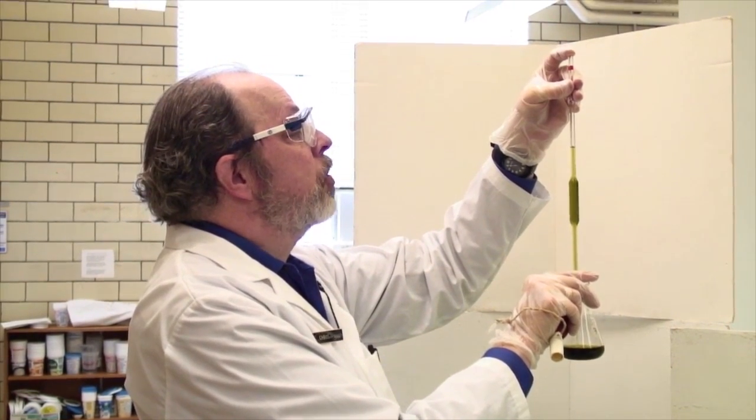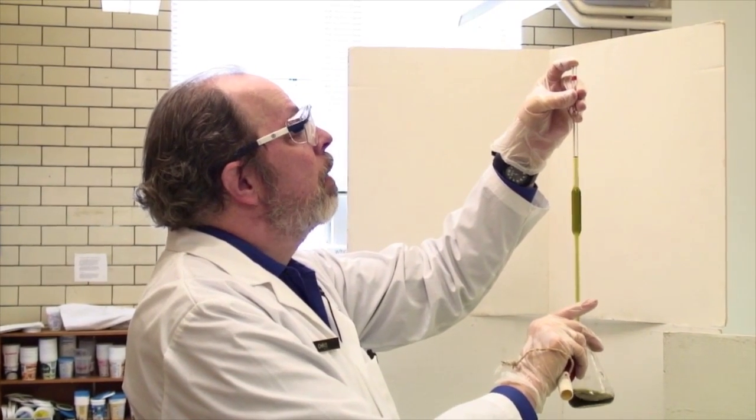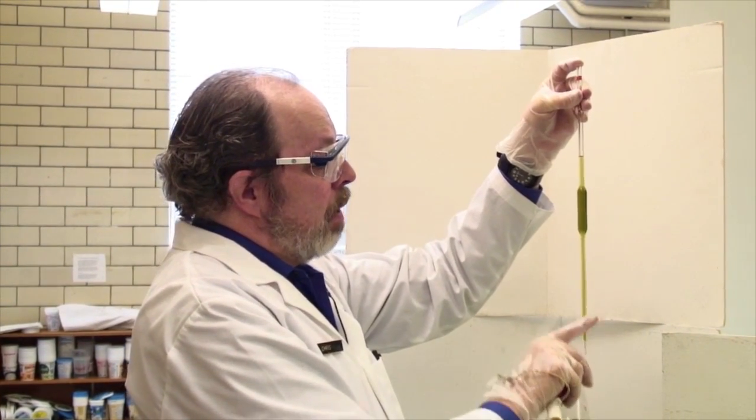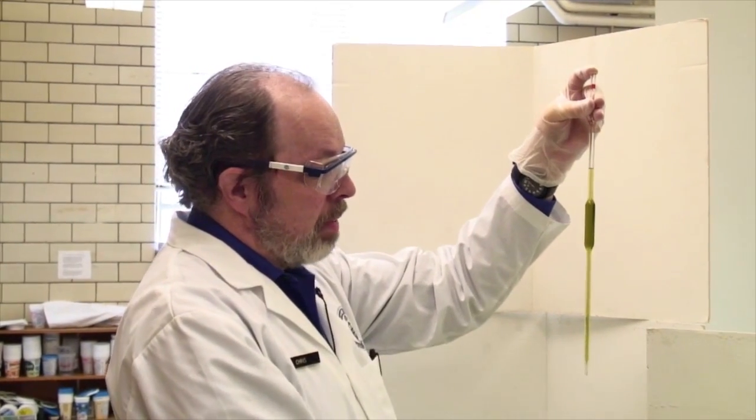By releasing pressure with your finger, you get the top of the meniscus down to the line. That's now ready to go.